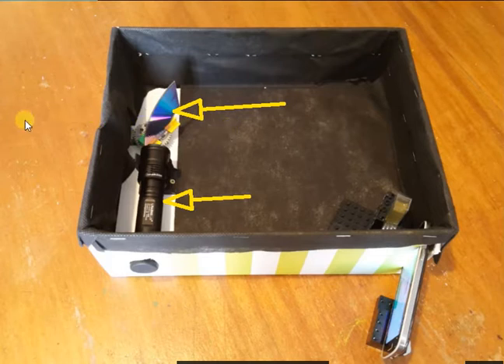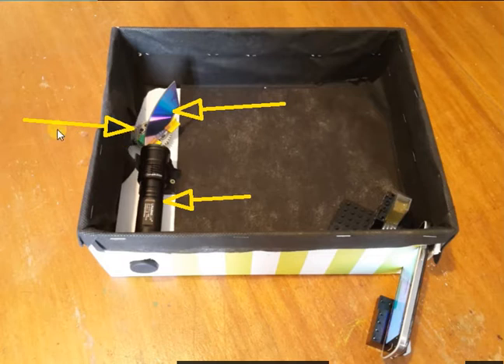I've stuck my quarter of a DVD onto this cogwheel which is joined to another cogwheel which points outside, and that allows me to rotate the disc and move the spectrum and aim the area of the spectrum I'm interested in to this sample holder here.